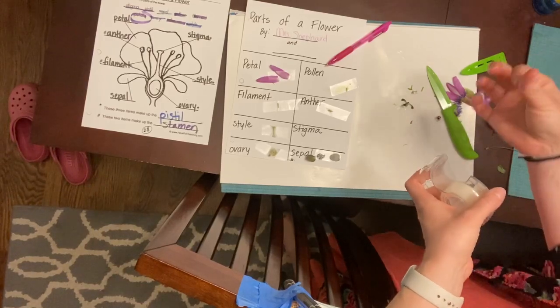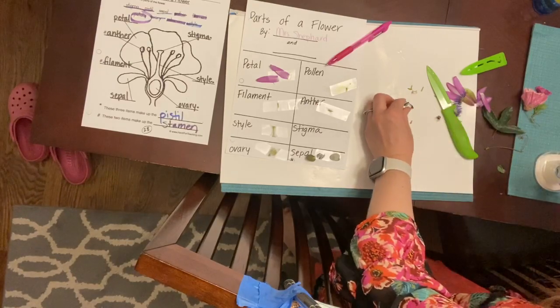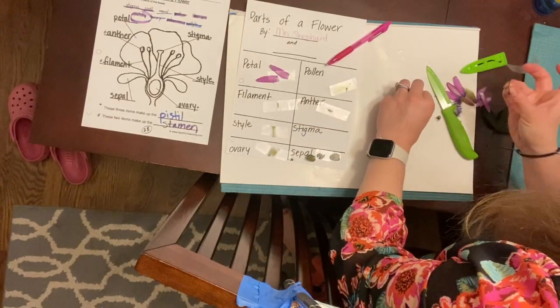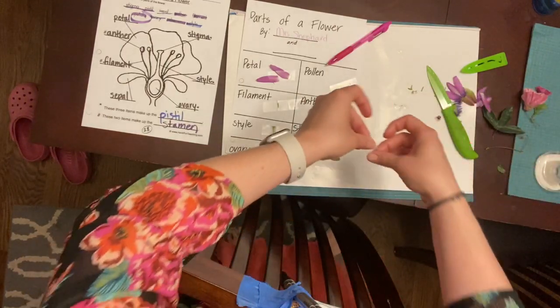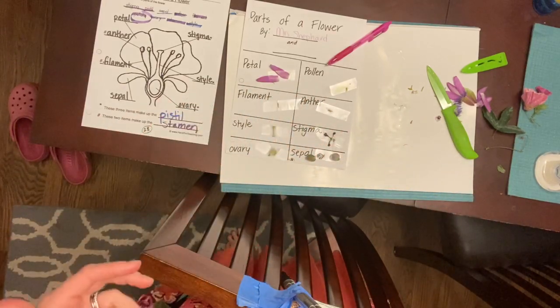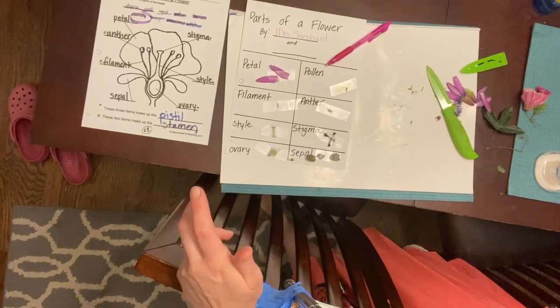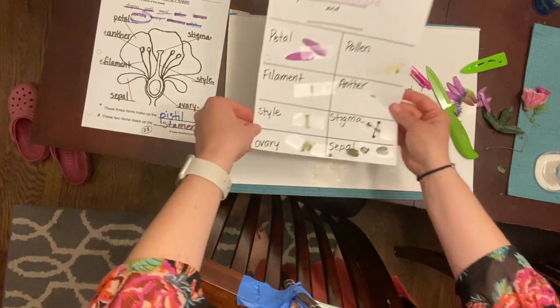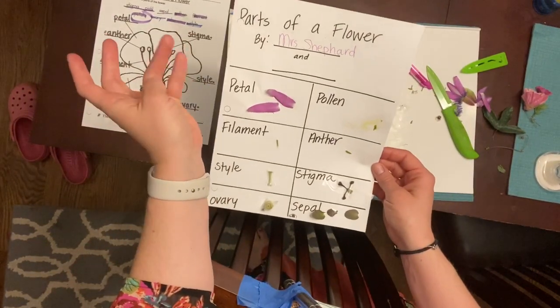And it's interesting, my hands are all sticky because it has all of the nectar inside as well. And so here we have the stigma, which is cool because it has all these dark purple parts that are to collect. So now I have dissected my flower sample, and I have collected parts of it on my worksheet, and I have completed this activity.